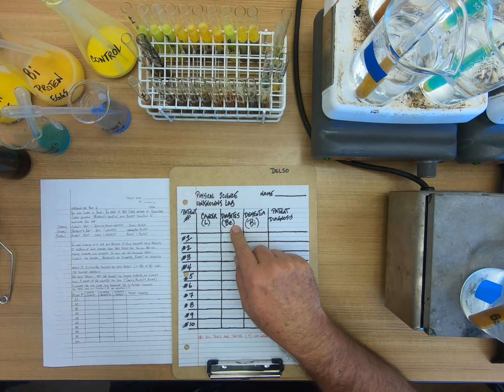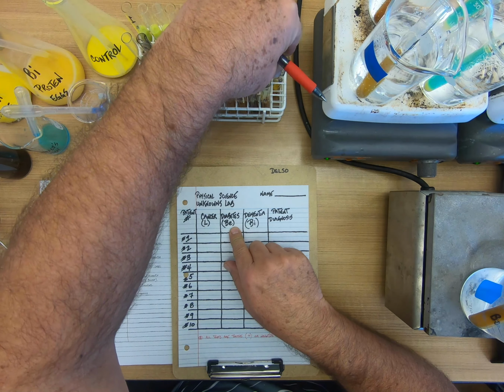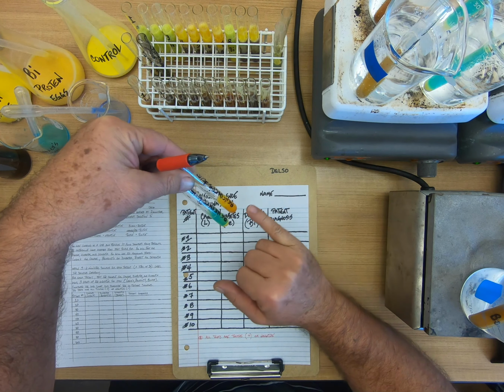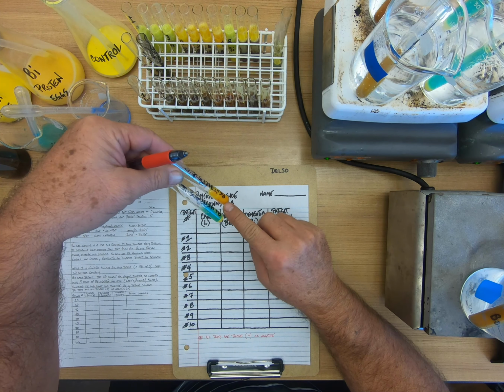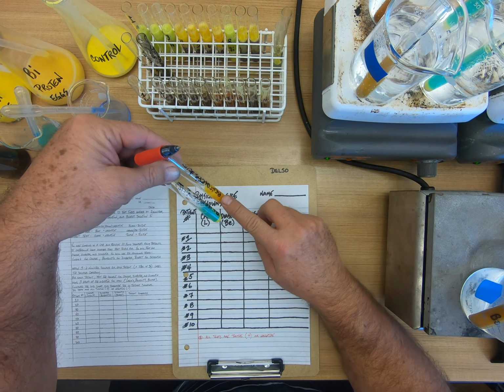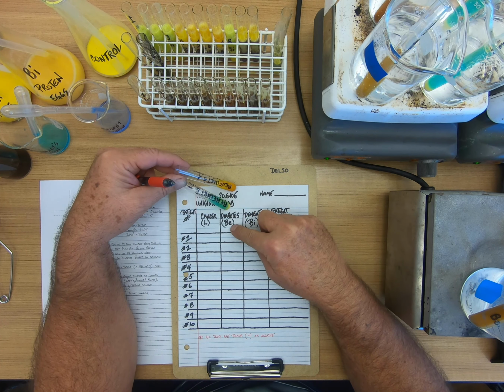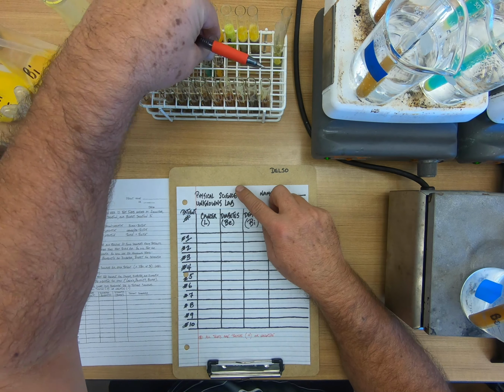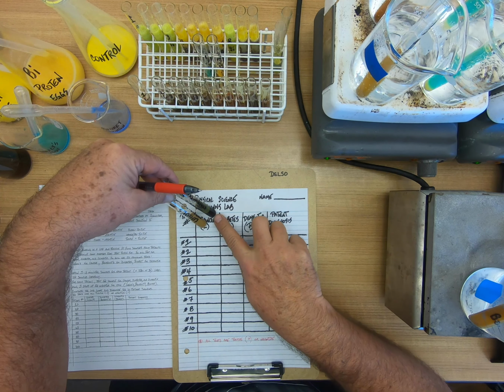For diabetes, we use the Benedict's solution. Now, Benedict's solution is normally this light aqua color. If you heat it, we have to heat this over on the hot plates, it will turn this orange juice color. It's an orange, and that's a positive test. So this is negative for a Benedict's test, this is positive, and we're using that for diabetes. So if you had this one, you would be negative for diabetes. If you had this one, you'd be positive for diabetes. With the Lugol's test, for cancer, this would be a negative, this would be a positive.